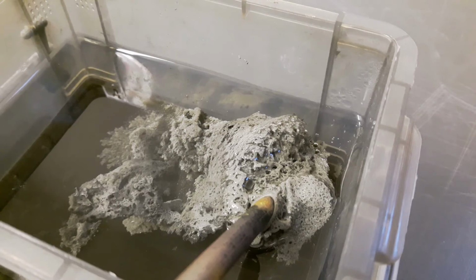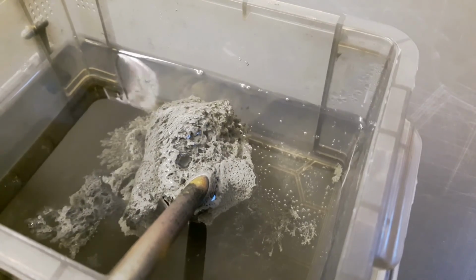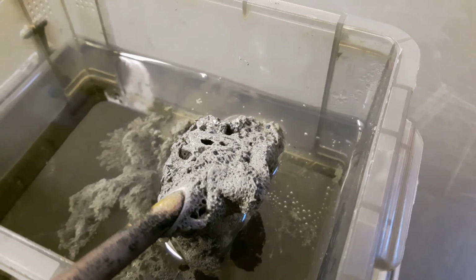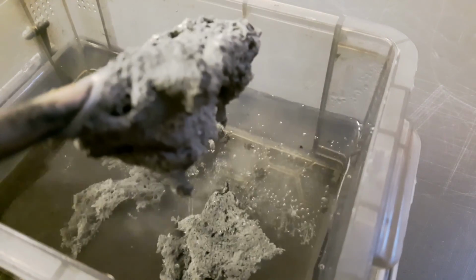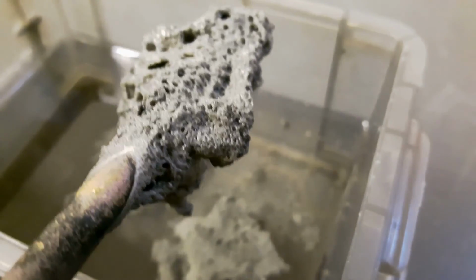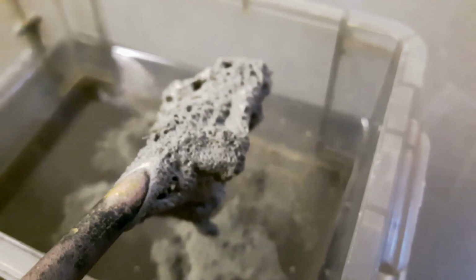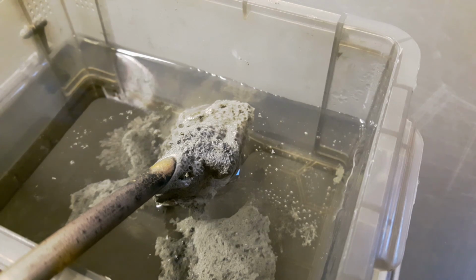It did grow some crystals, but it created mostly some kind of foamy structure, and this is because there was still hydrogen production in the tin, and this led to a structure that looks like this. You see, there are also some hydrogen bubbles coming out, and this is really, really strange. It seems that it's not very strong. Actually, it isn't. It fell off. But it's a clearly foamy structure.